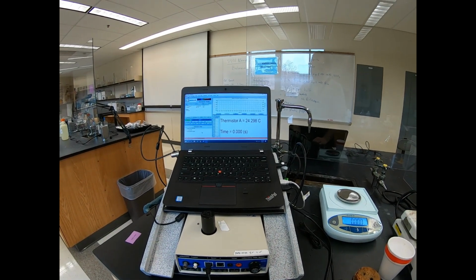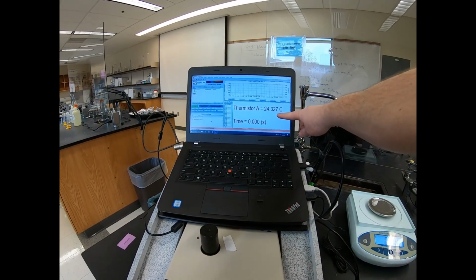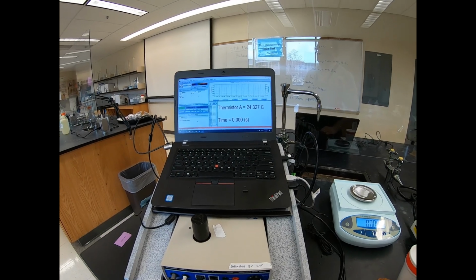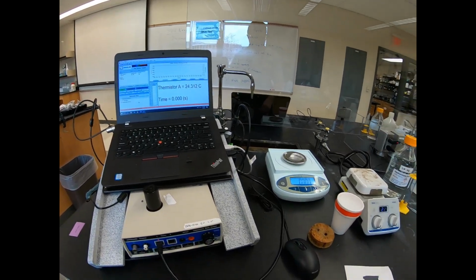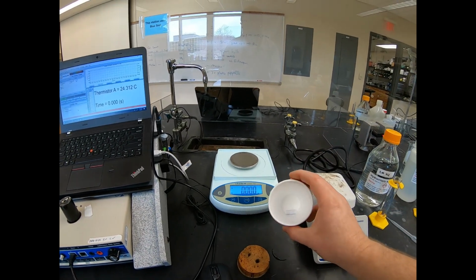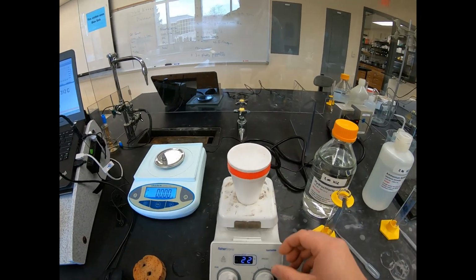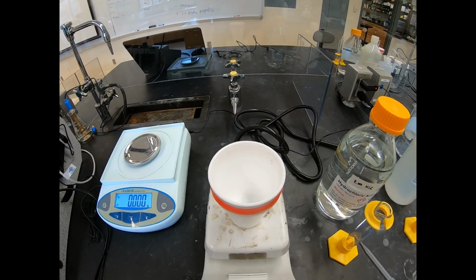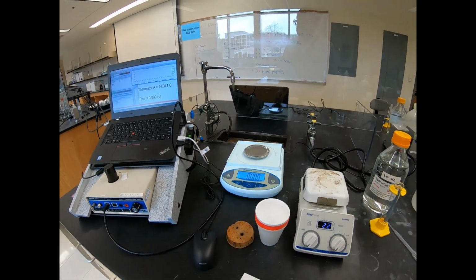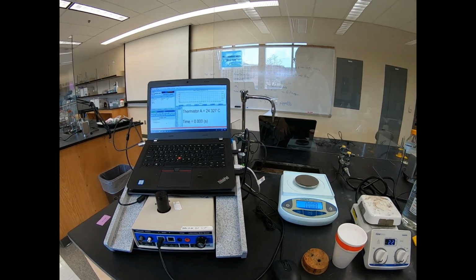Okay, a couple differences in this video compared to video number 1. First, I realized in video number 1, the temperature was kind of small, so I zoomed that in so it's hopefully easier to record on this video and subsequent videos. Okay, we still have our balance over here, currently zeroed out. Our coffee cup calorimeter now has a stir bar in the bottom, so that when we put it on here, I can have it stirring the 2 reactants together. That will enable me to not haphazardly hand swirl our reaction.